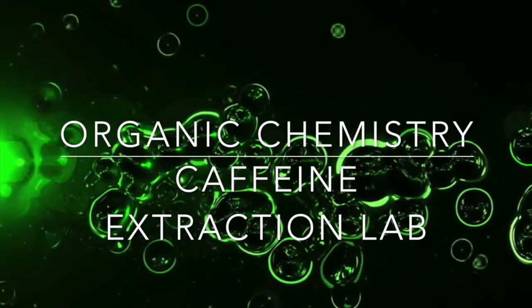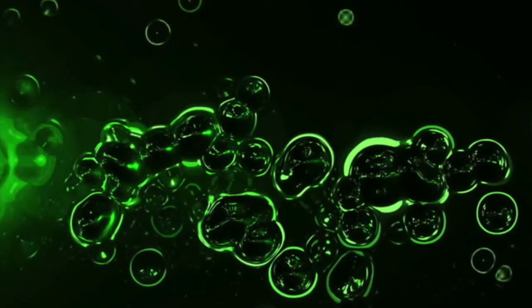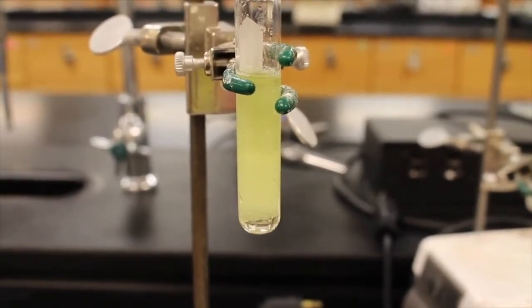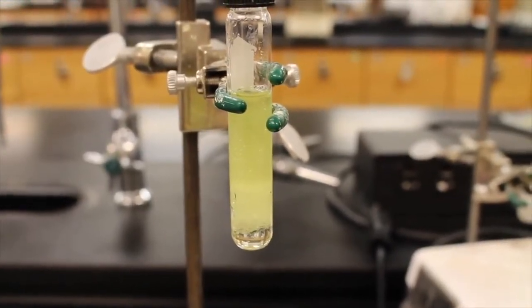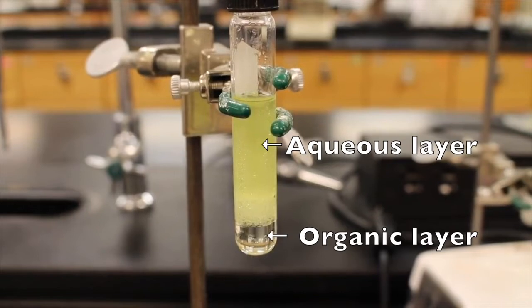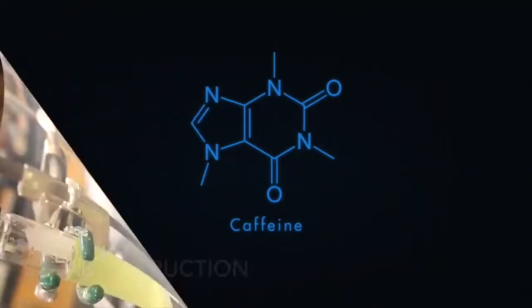In this lab, you will be using a phase separation technique called extraction to isolate an organic molecule, caffeine in this case, from a mixture. You can separate an organic molecule by extraction with an organic solvent. In this video, you can see that as the mixture is allowed to separate, different layers form. The cool thing that happens is that as the phases separate into organic and aqueous, the organic phase drags, or the proper term is extracts, organic molecule from the aqueous layer into its own phase.